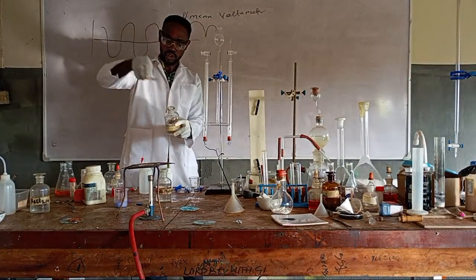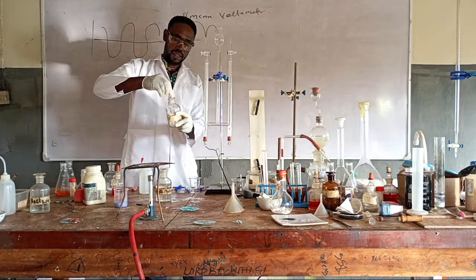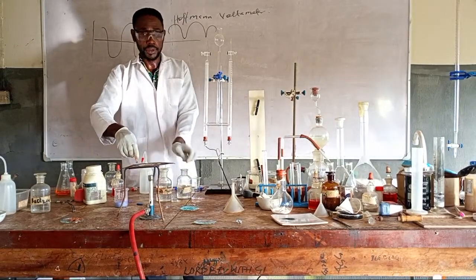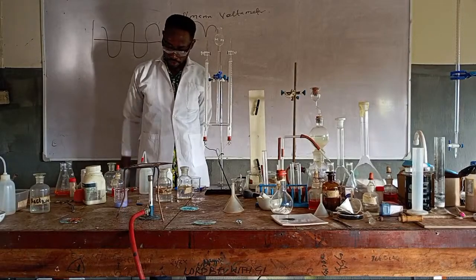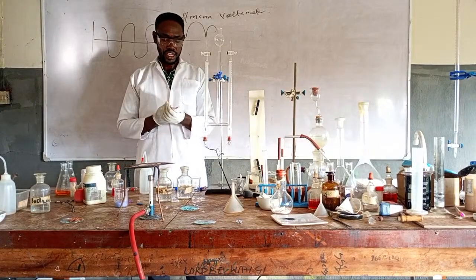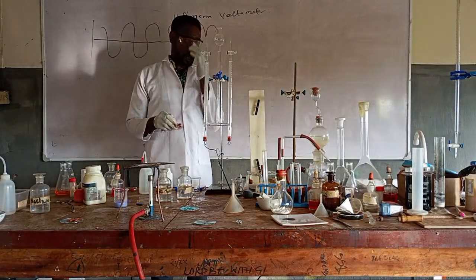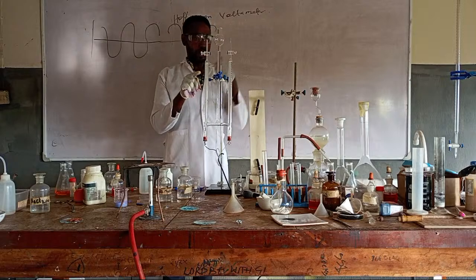You can still see a little blue, right? If you put it there, see, it has turned pink. So why? Because there is water in it. It is not sensitive to acid or base, but rather is sensitive to water. Your yam, as far as there is water in it, will do the same thing. I think even though the rate is slow, it is showing us.